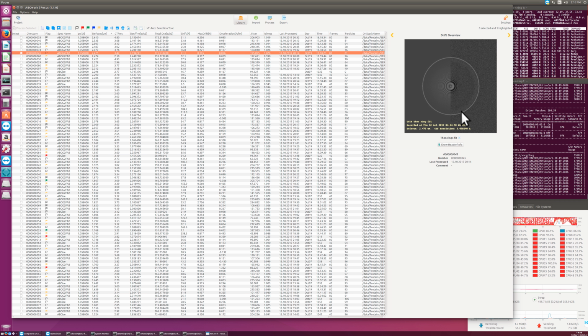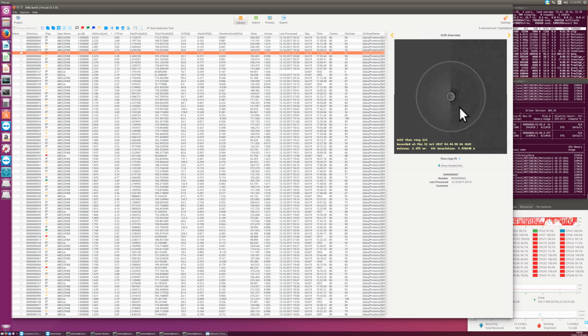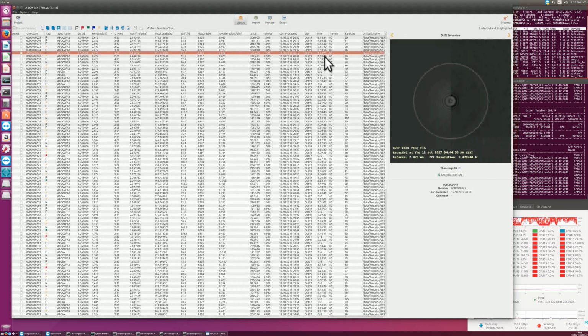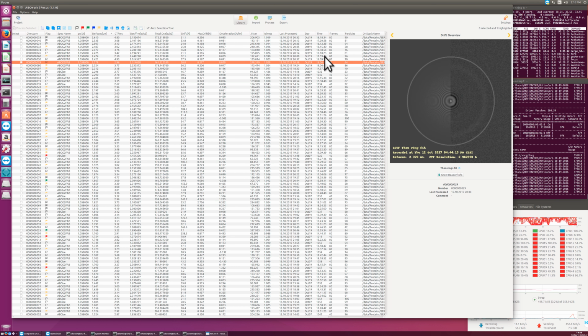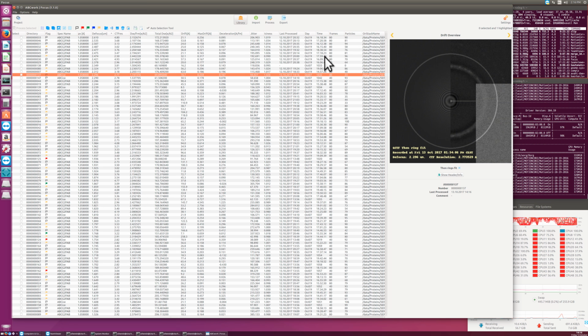So then you have them in the full view there, and only that. And these images here are always PNG files, which are very small and can be displayed rather fast. And if you double click on this PNG thumbnail, then you see the full MRC file in the full resolution, which can be an 8K file or 4K file. So here with this preview, one can go over this rather quickly because it's a small PNG preview.